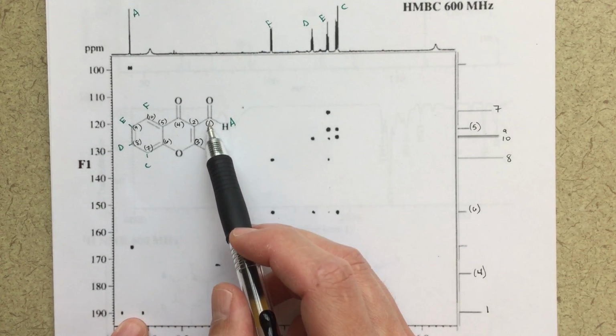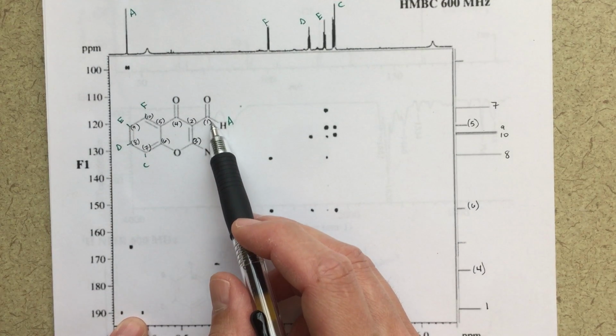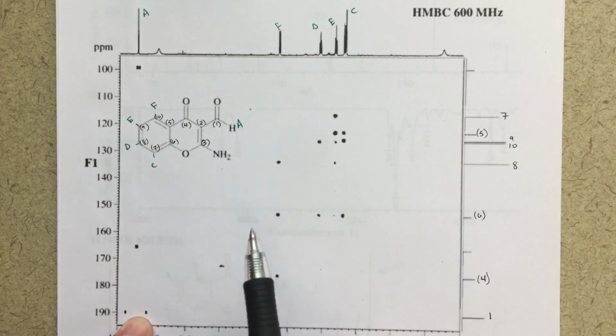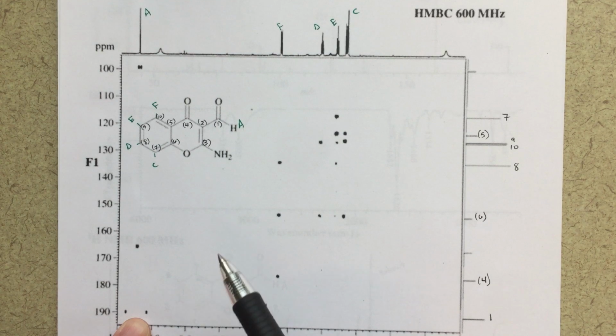So we know that this should be 1, and we know that this obviously is our proton signal for A. So this correlation that we're seeing here, the fact that it's a 1 bond correlation is making it split, so we would have a coupling constant here. And so if we do see a 1 bond correlation, we should expect to see 2 peaks that are split, that are centered around whatever this shift is for A.